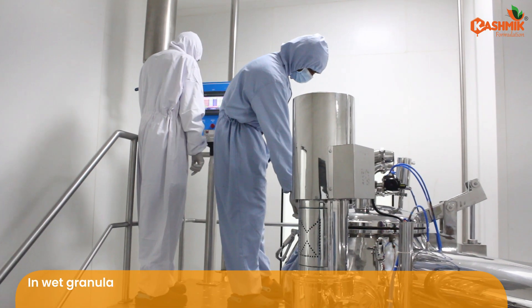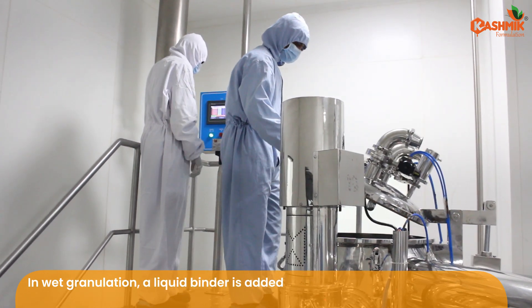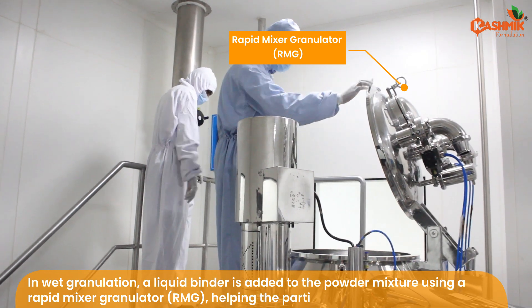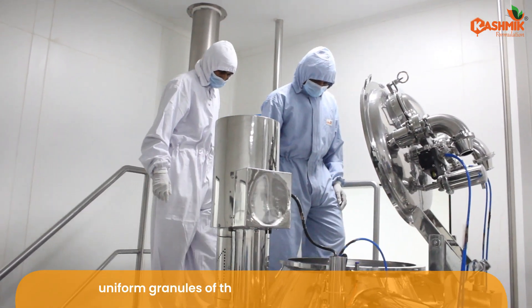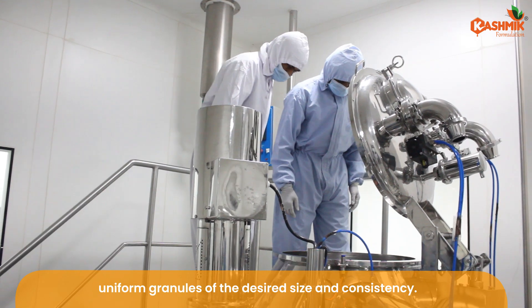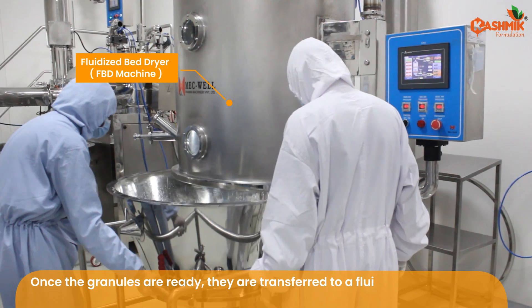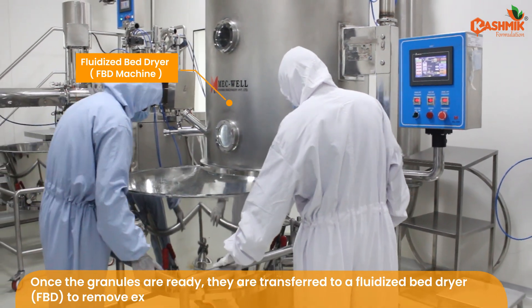In wet granulation, a liquid binder is added to the powder mixture using a rapid mixer granulator, RMG, helping the particles stick together and form uniform granules of the desired size and consistency. Once the granules are ready, they are transferred to a fluidized bed dryer, FBD, to remove excess moisture.